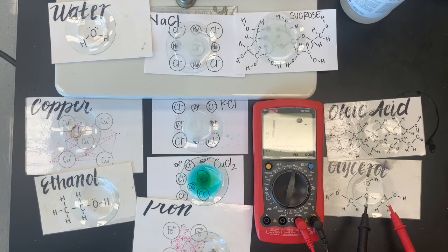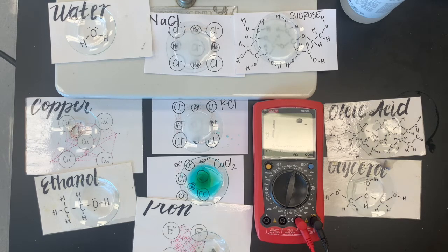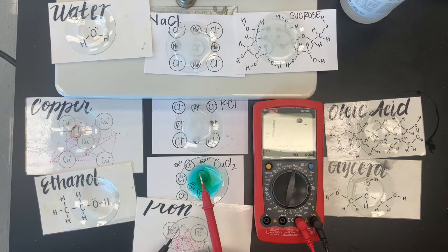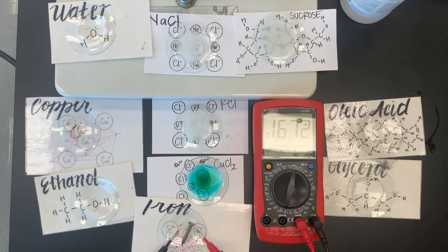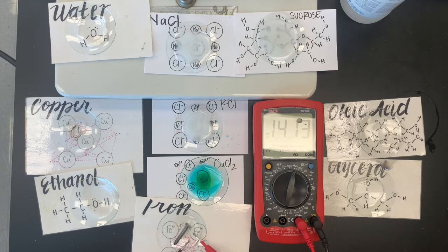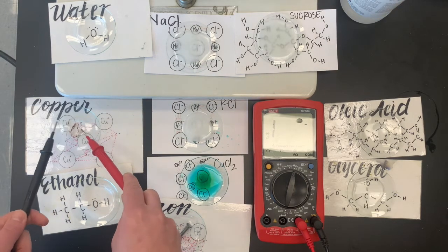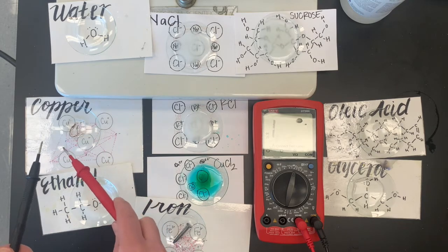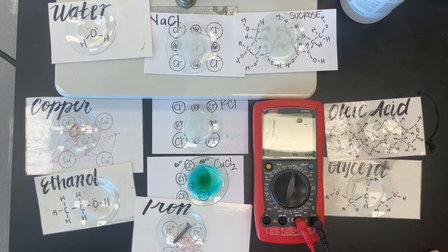Glycerol. I don't know if you decided if this dissolved or not, but we're not getting any conductance there. And, well, let's just check these. So the iron in the water doesn't actually do anything. So if I put it on the actual nail, we're getting conductance over here, nothing. And let's just double check. Same with the copper. So the water doesn't do anything there. It conducts.